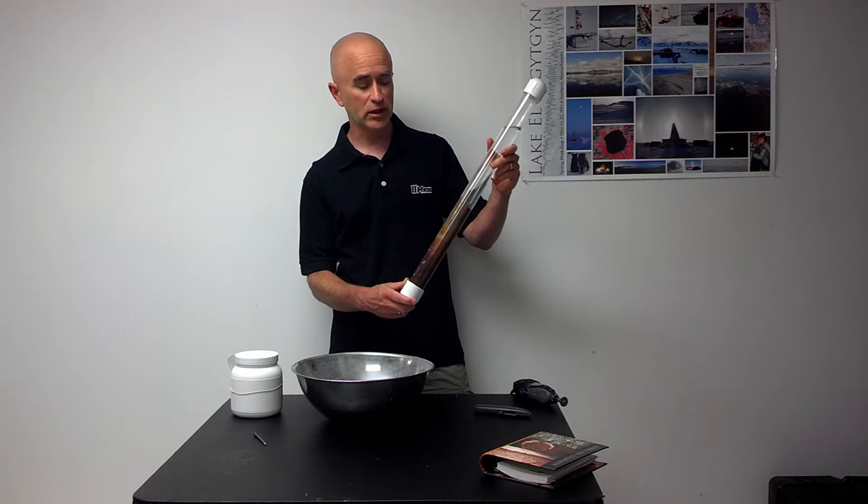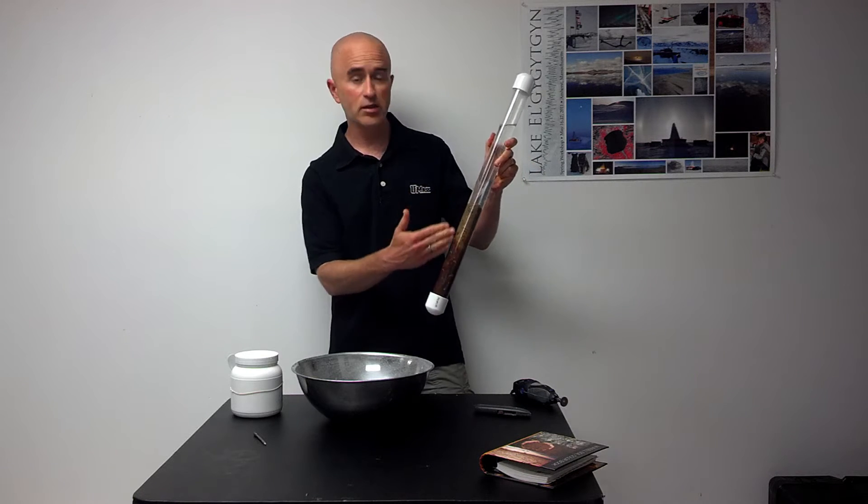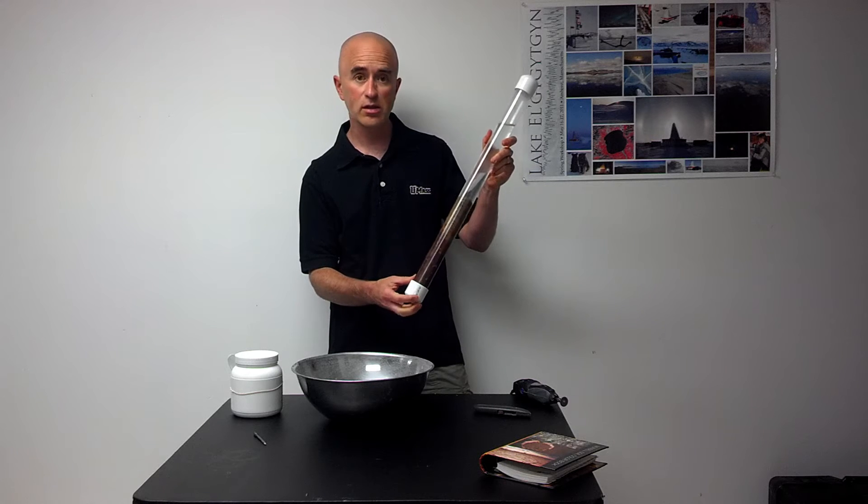Once the sediment has been retrieved from the lake, the next step will be to cut the sediment core tube so we can see the sediment inside.